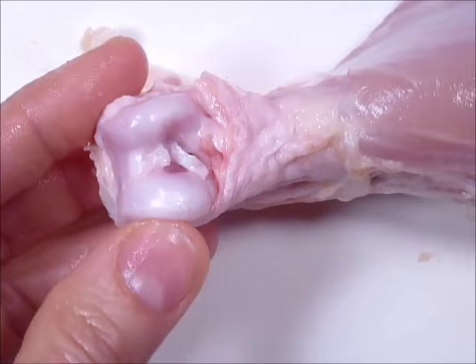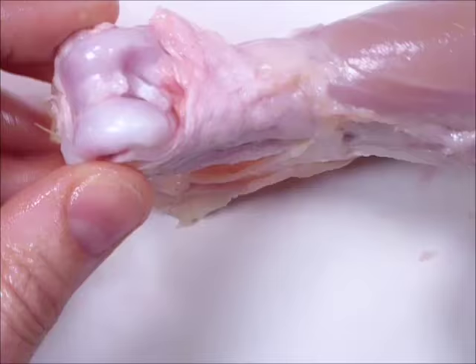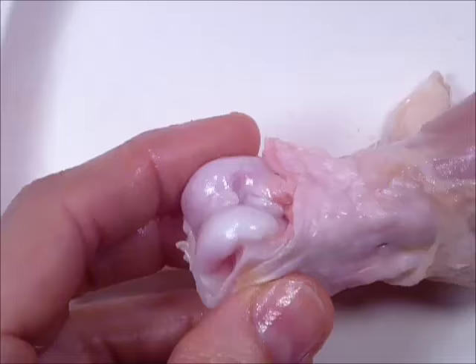This is the type that has the chondrocytes and the lacunae. The main feature is there are no capillaries and no nerves. Being at the joint, this would connect to another piece and this is where all the rubbing goes on. You really don't want nerves right here because this is what's going to rub like this all day long — you want this padding to be nice and slippery and not painful.